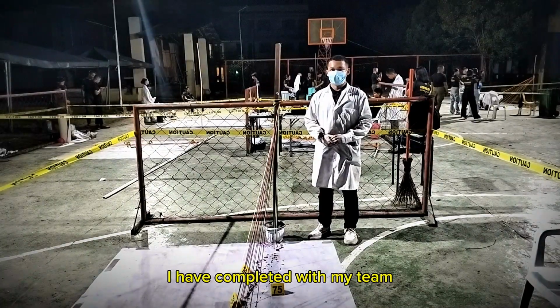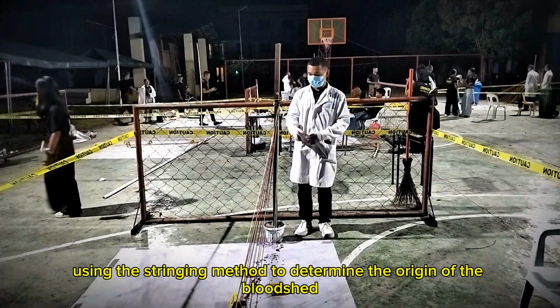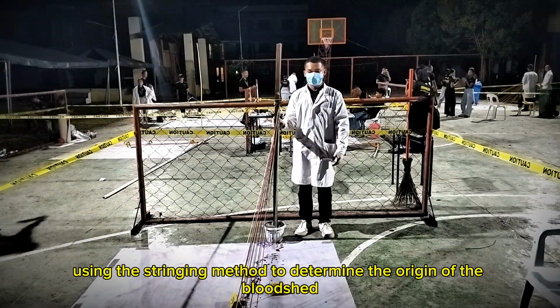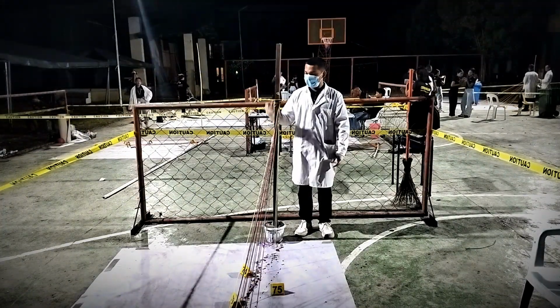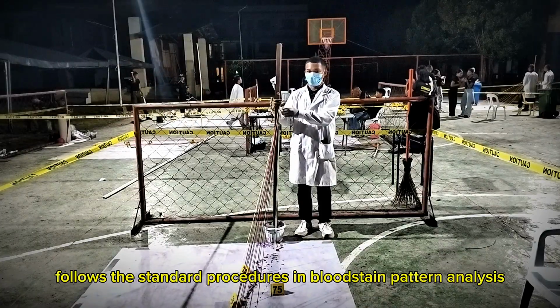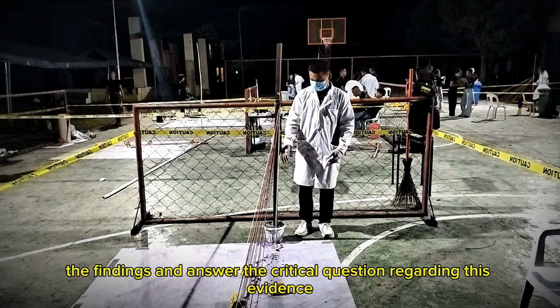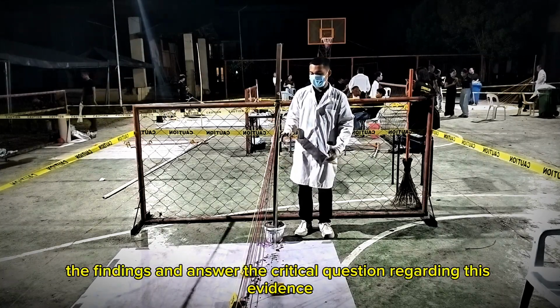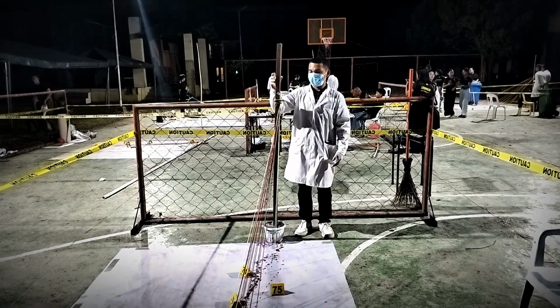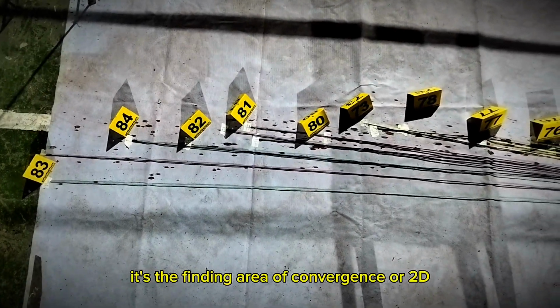I have completed, with my team, the reconstruction process using the stringing method to determine the origin of the bloodshed. My analysis follows the standard procedures in bloodstain pattern analysis. I will explain the steps, the findings, and answer the critical question regarding this evidence. First, finding the area of convergence, or 2D.